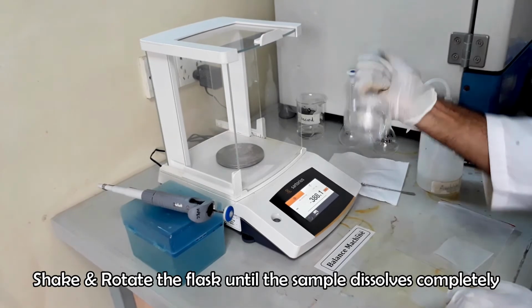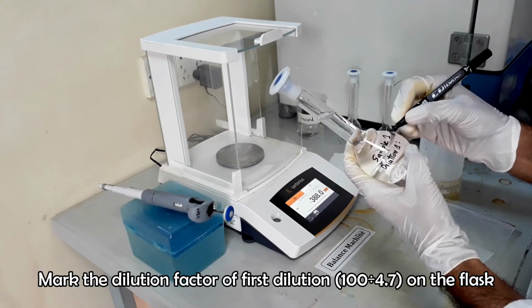Shake well to dissolve the salt with water completely. First dilution of the sample is ready.